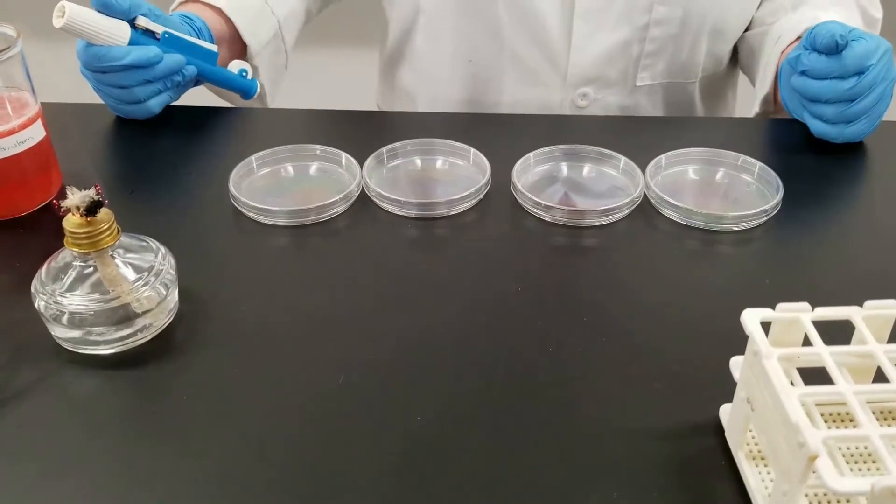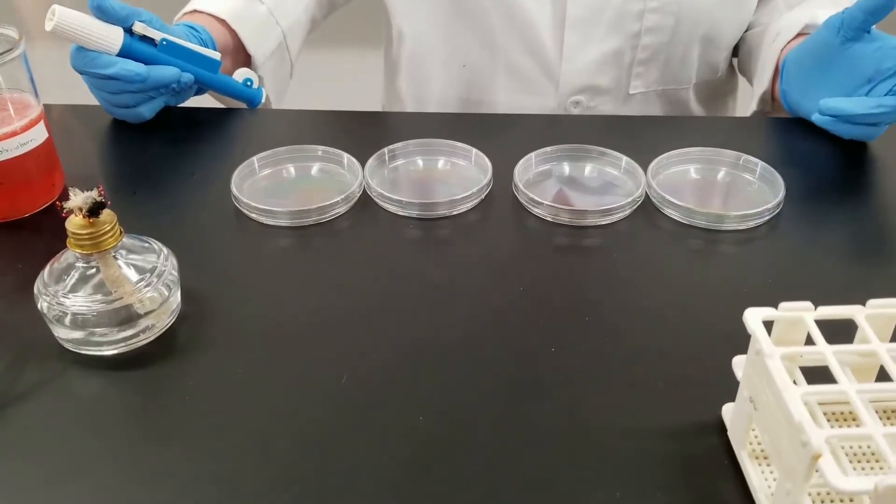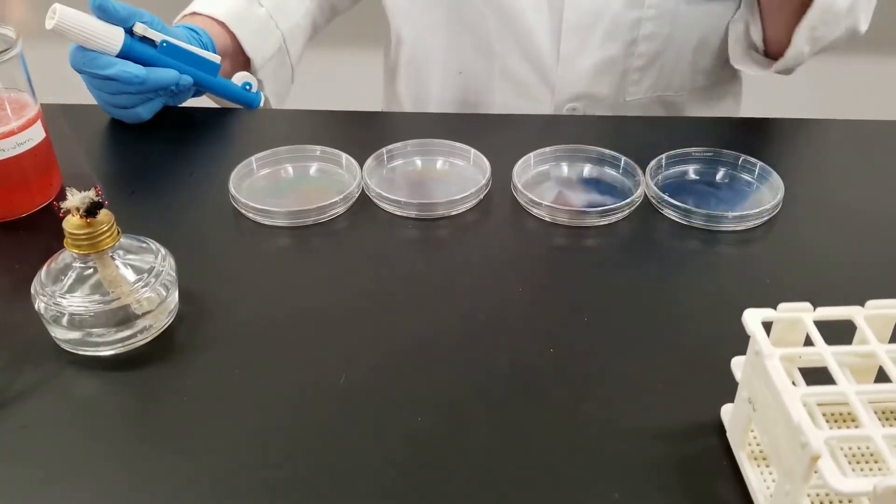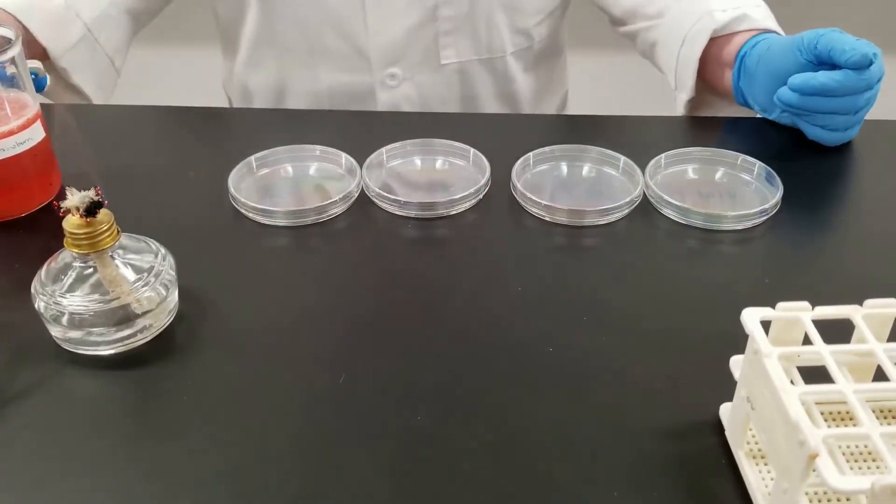This is an experiment looking at food microbiology. We are taking a food sample. You could take multiple things like hamburger, potato salad - we're taking some fresh strawberries.